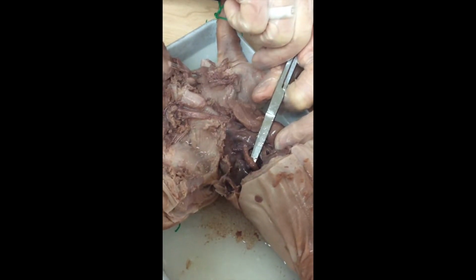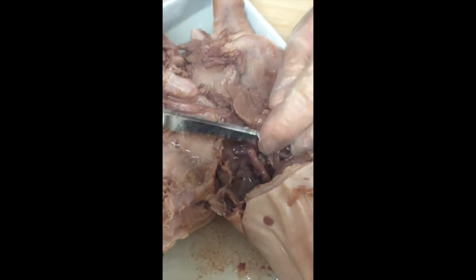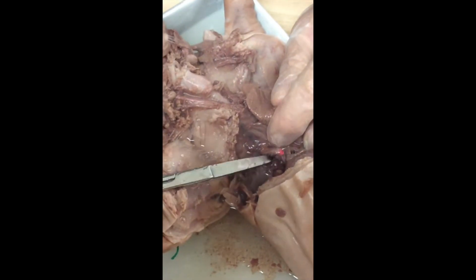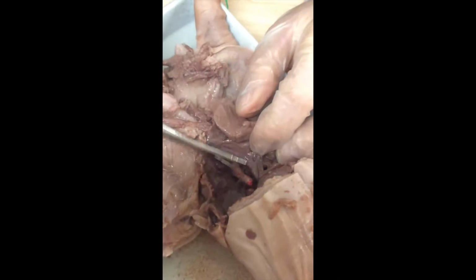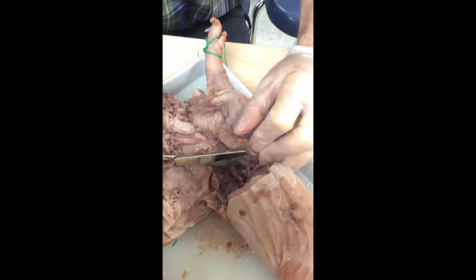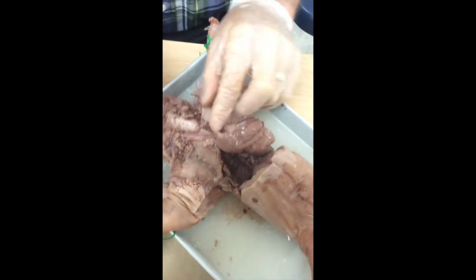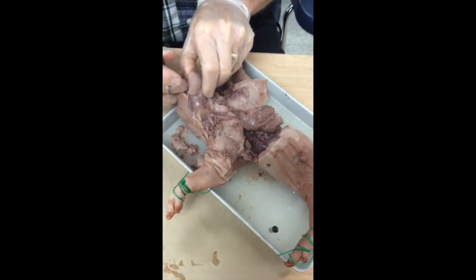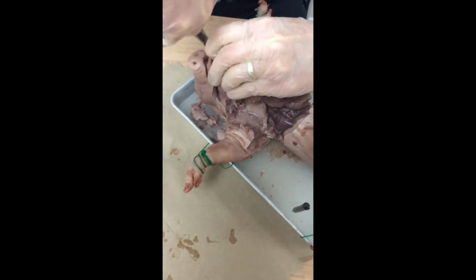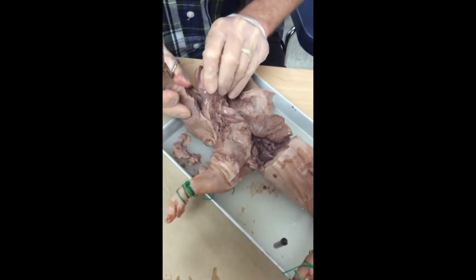It's a monster. It's very tough, and you will see when I cut this that it is filled with latex, and I'm going to go ahead and cut that right now. And there you go. You see the red latex inside of that vessel. I'm going to cut the inferior vena cava as well, because I do need both of those out of there. All right. Now I'm actually going to do maybe more than what you will. I'm going to try to get the entire reproductive tract intact coming out of here.